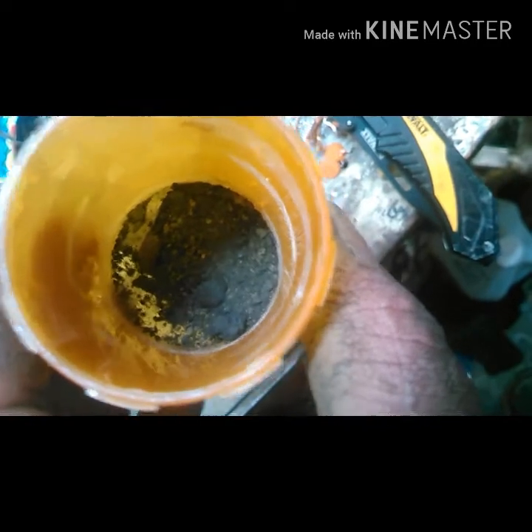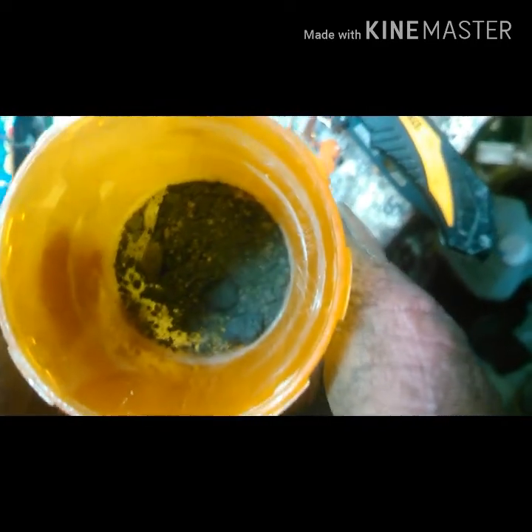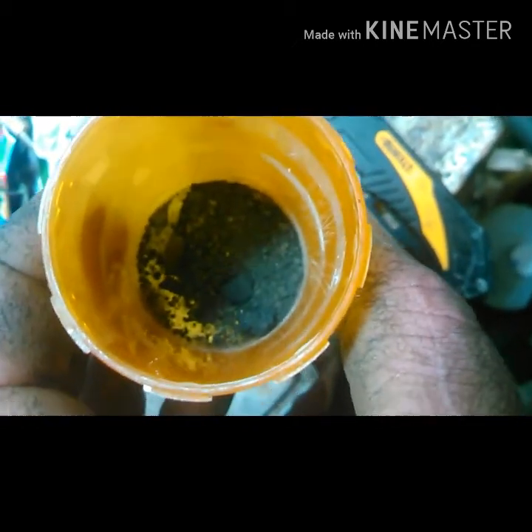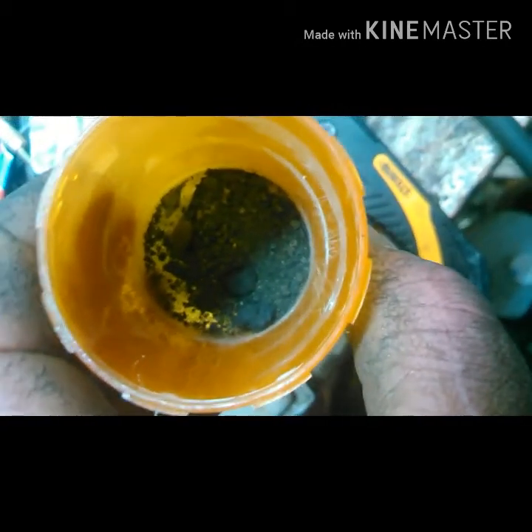There's what I got — it's like 2.9 grams. Decent amount, especially just for cleaning out filters. In total, I got about 24 grams from this run of five and a half catalytic converters. I still have one more filtration to clean up, but the coloring's pretty light so it won't have a whole lot left to it. Anyway, until next time, guys. Thank you.